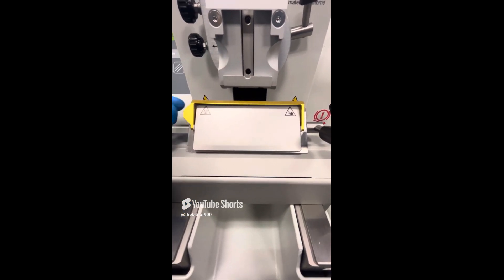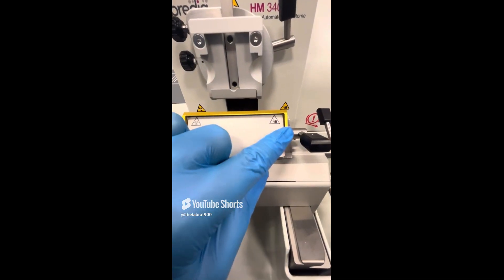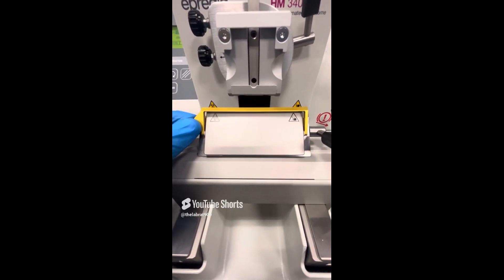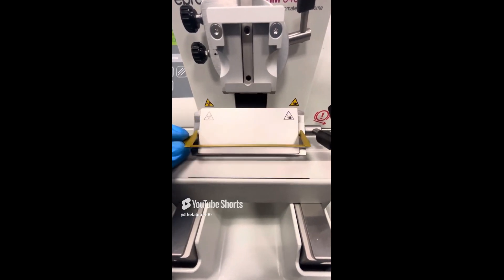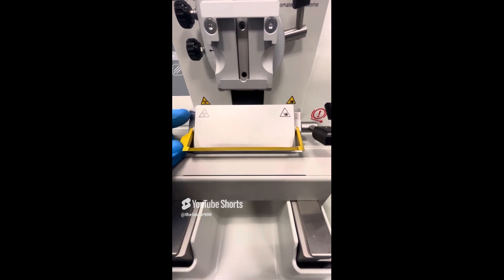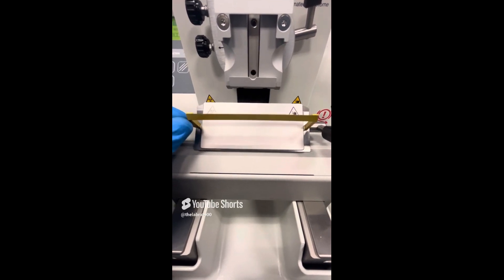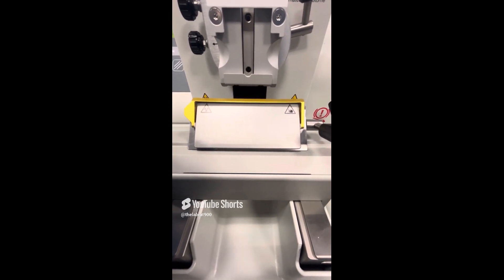It does have a place for your fingers right here, so you never want to move the knife guard from the top or from the side — you want to move it from this finger area here. That's how you move it up and down. When it's up, your fingers are going to be protected from that knife. When it's down, it's going to reveal the blade. I do not have a blade in here for the purpose of this video, but I'm still not going to touch that area because there are still some sharp edges there.